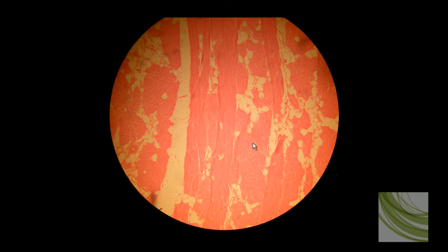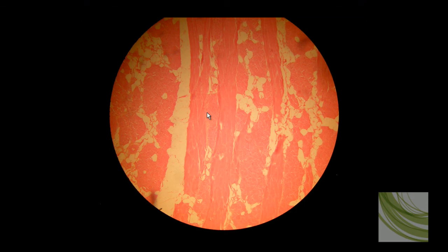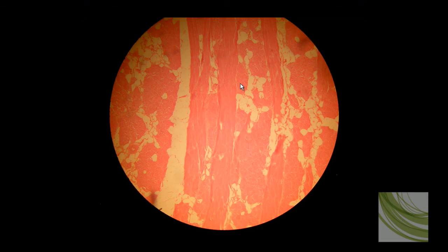Here is the same slide using the 10X objective. We can see a lot of fat tissue. There isn't a lot of detail on these cylindrical fibers yet.